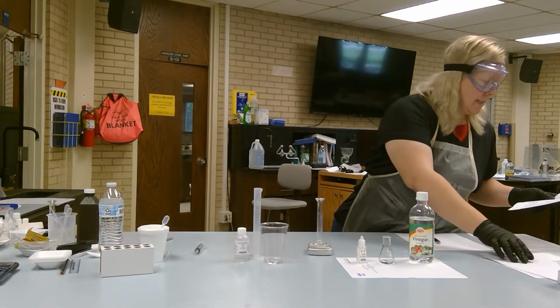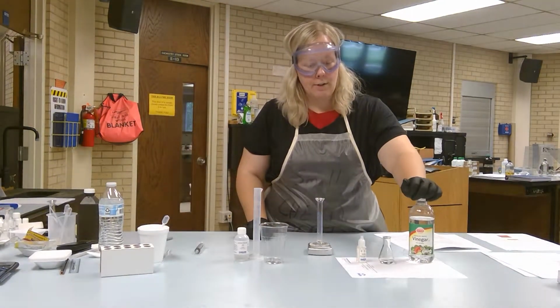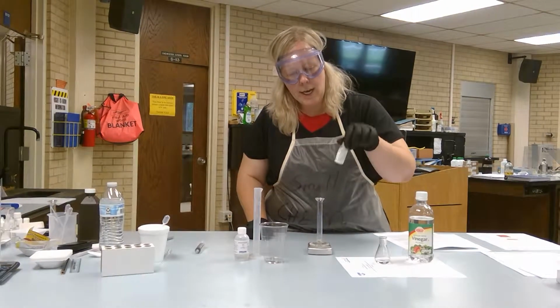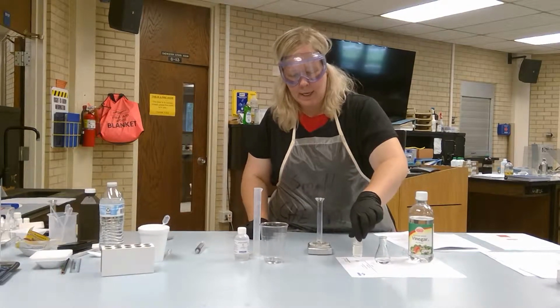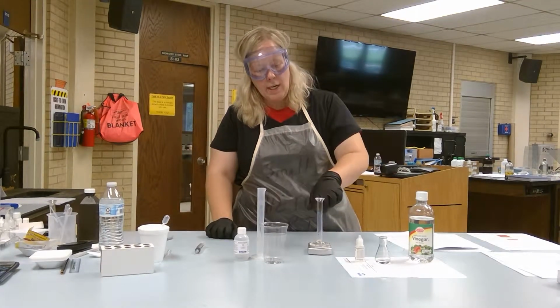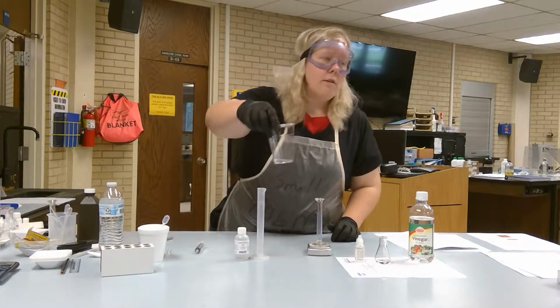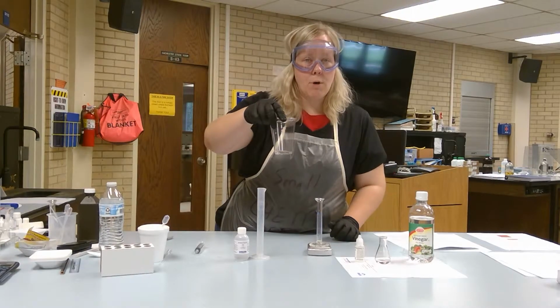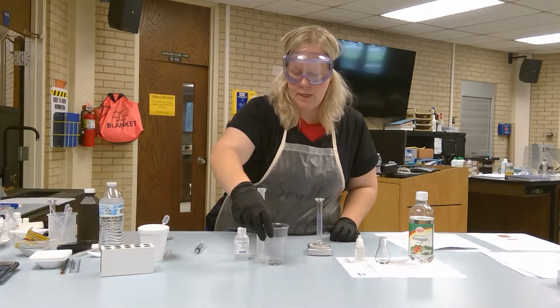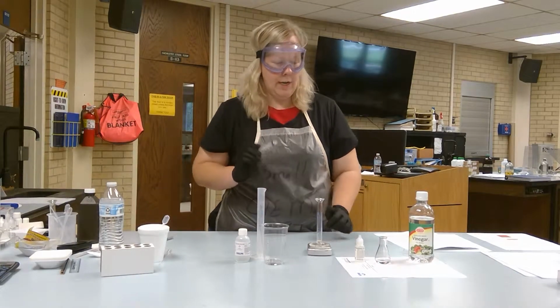All right, so now that I've got my page, I'm ready to walk you through some of the stuff that you're going to need. You're going to need your bottle of vinegar, your 25 milliliter Erlenmeyer flask, and a bottle of phenolphthalein, which is an acid-base indicator. You do need a 10 milliliter graduated cylinder and your balance. Somewhere in your kit you should have small medicine cups, but I had a bigger cup available. You also need your 1 molar sodium hydroxide and your syringe.